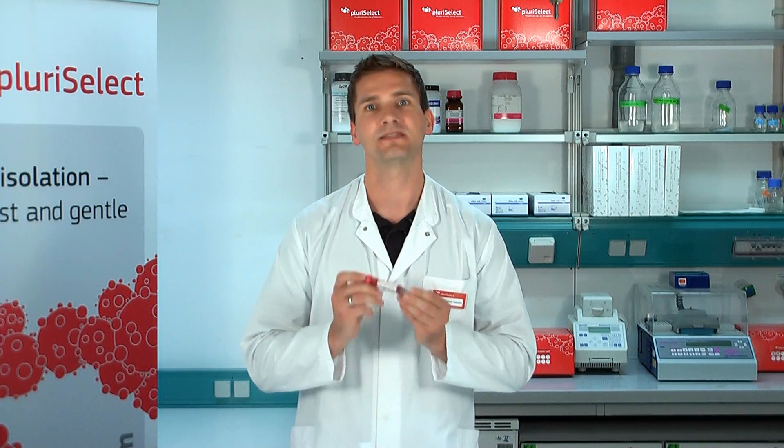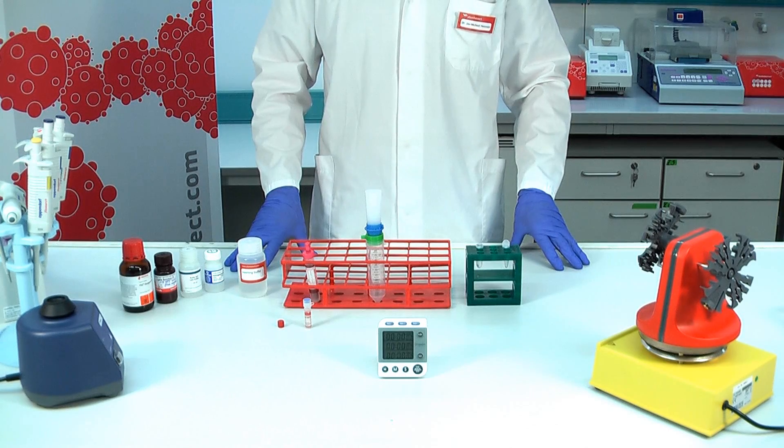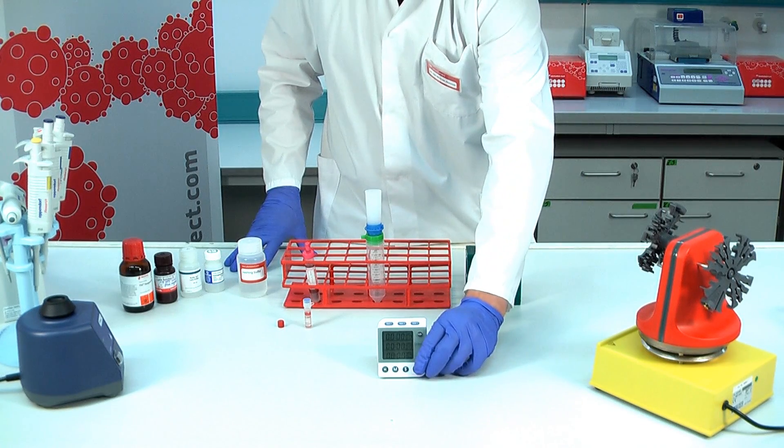This is EDTA whole blood. Let's see how fast we can do it. We film in real time, so no cuts. Let's start the stopwatch.